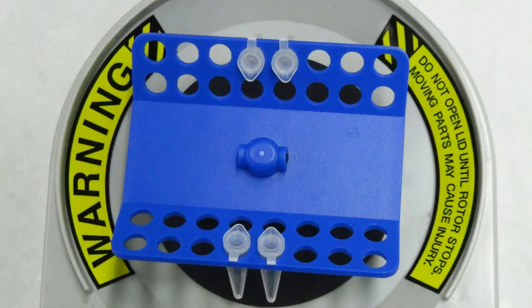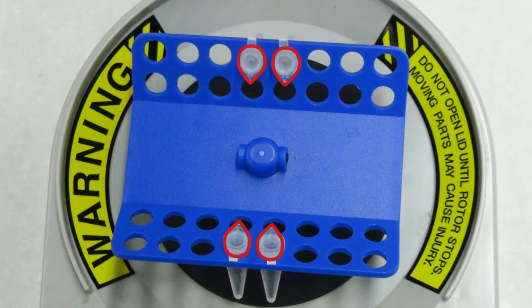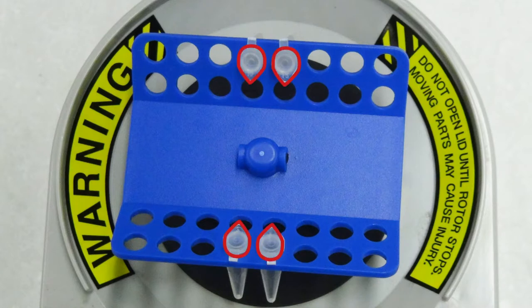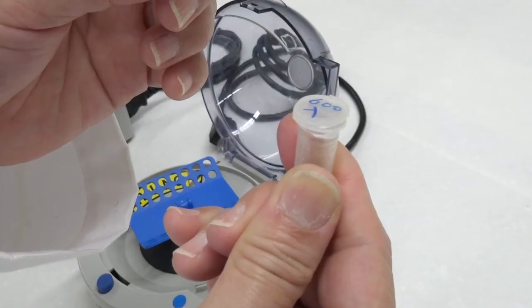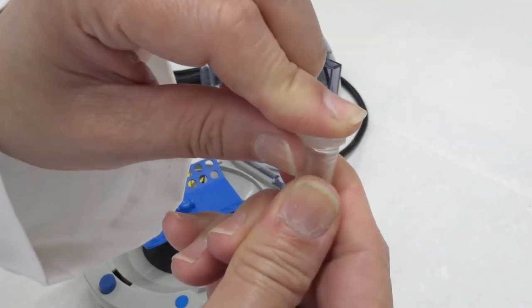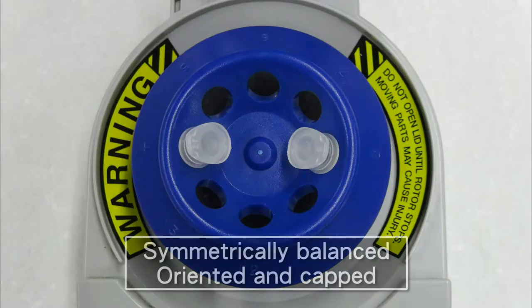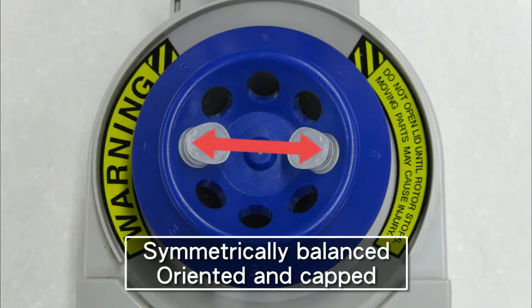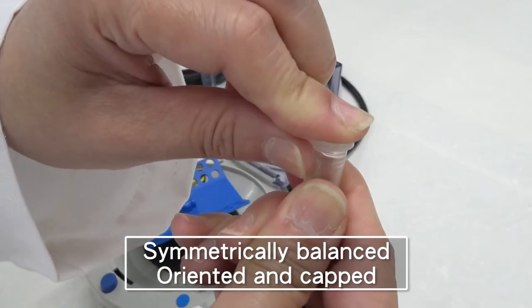Keep the orientation of centrifuge tubes fixed during placement to allow for convenient examination of centrifuge results. Finally, check if the centrifuge tube caps are thoroughly closed tight. Mnemonic: symmetrically balanced, oriented, and capped.